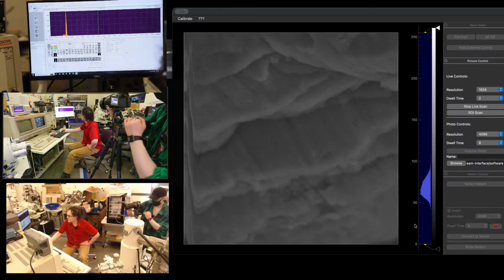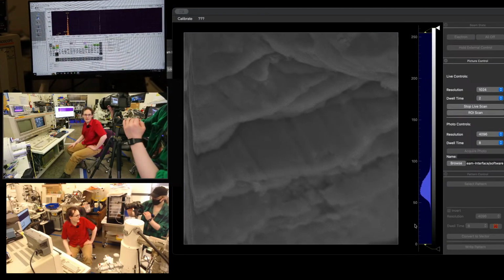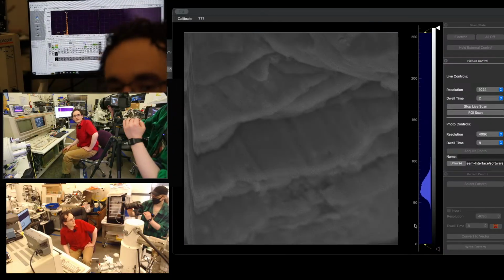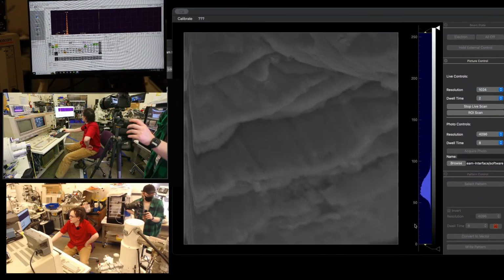Okay, we got a peak. What do you think it's going to be, chat? Aluminum. Okay, it appears the flakes are aluminum. Yeah, we got a little bit of aluminum, magnesium, fluorine peak. I am suspect of that, but okay, that is cool.